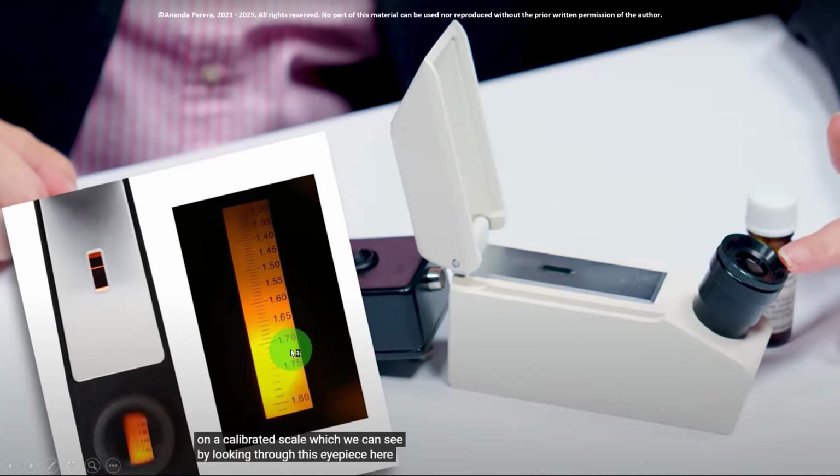Then you can see here the little darker area and the brighter area separating from here. The separating place you have to read. 1.70 is this one. Then 1.71 is the next line. Next line 1.72.